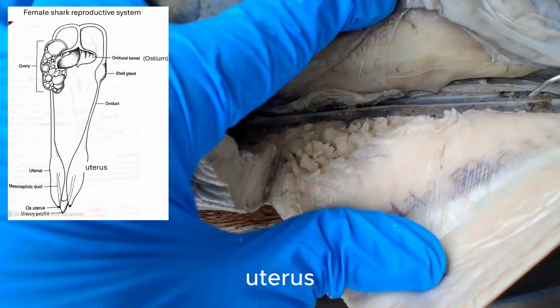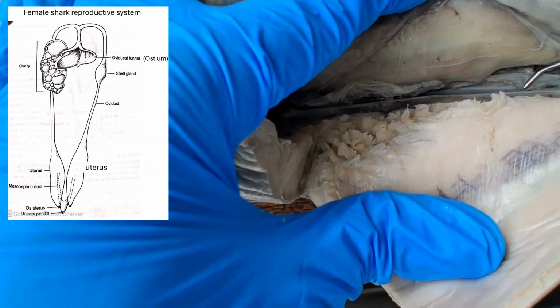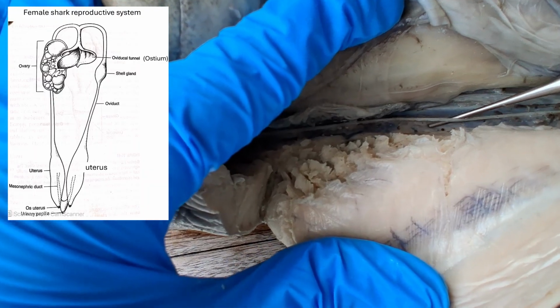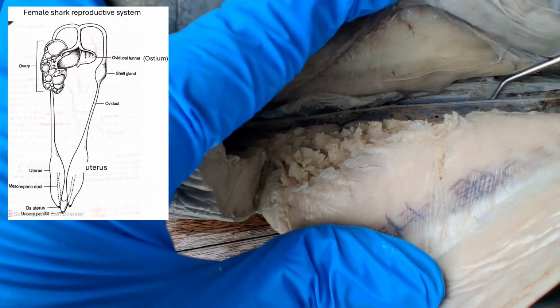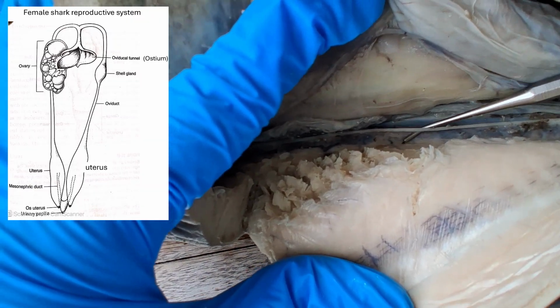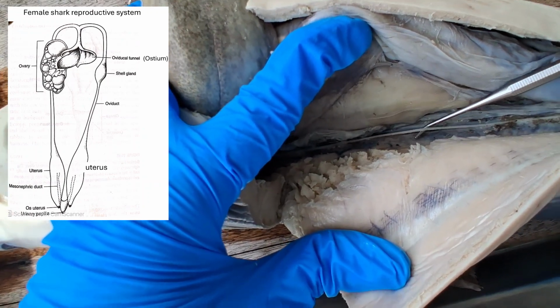This shark was not pregnant, but when there's a fertilized egg, the uterus is where the embryo will be gestated, because some shark species like the Rhizoprionodon are viviparous. Instead of laying eggs, they gestate or incubate their embryos inside their uterus and then give birth to live young.